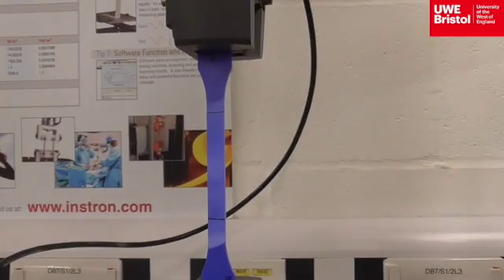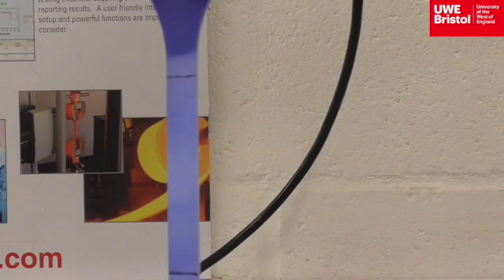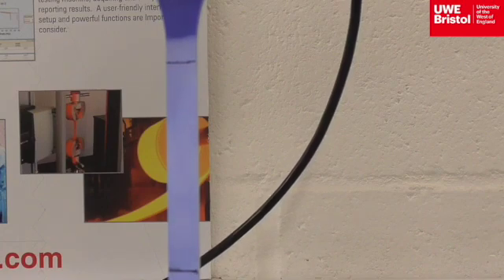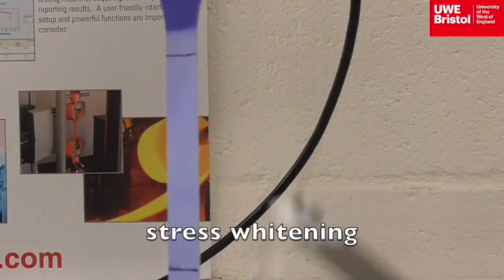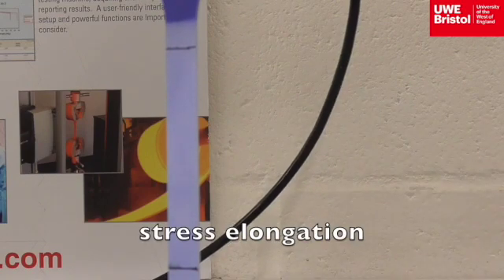Closely note the colour change. It happens quite quickly as it's being pulled in tensile testing. This colour change represents multiple stress crazing within the material. This change is referred to as stress whitening. Stress elongation is observed as the material gets longer.